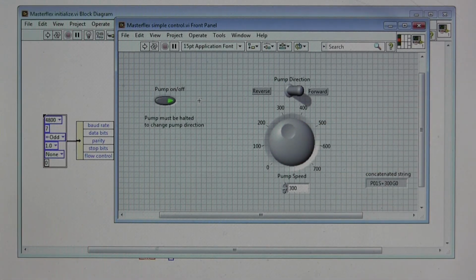And that teaches us how the communications with the pump occur. The pump really just receives individual signals, and it will continue doing whatever setting it's on according to the last signal that it received. So sending this command of the pump on off is just like turning the pump on and off using a button at the pump itself. So the program doesn't have to run continuously, and that's important because it's nice that we don't have to run the program continuously. We only need to call it when it's time to turn the pump on or off or change the pump speed.